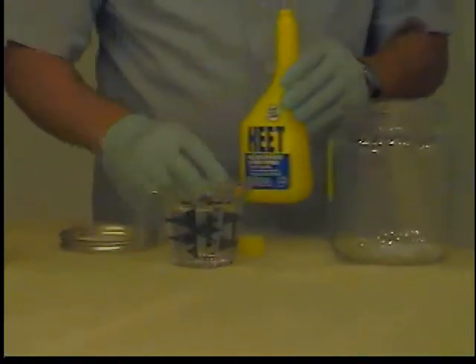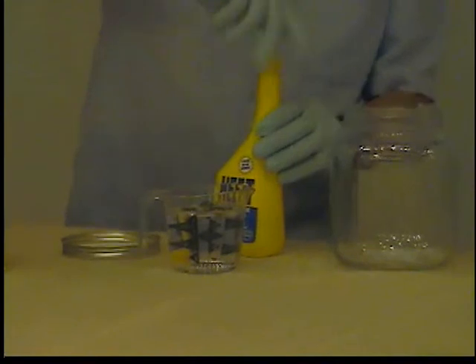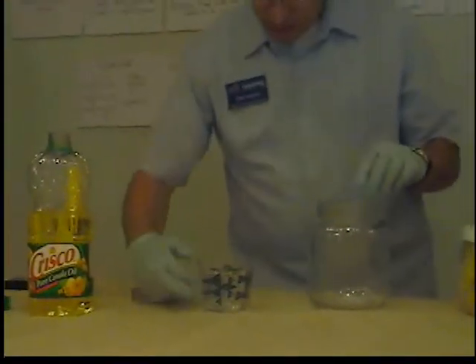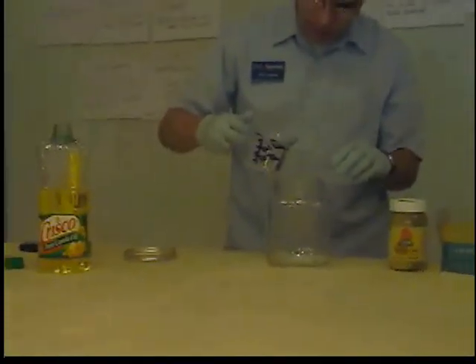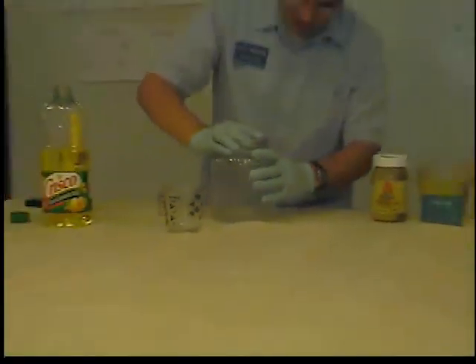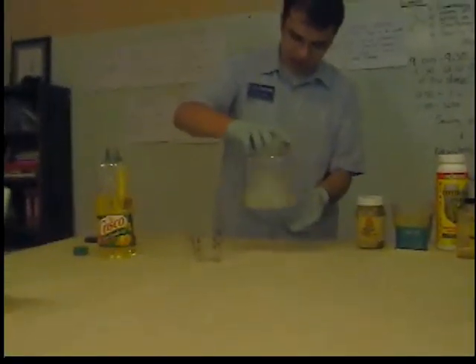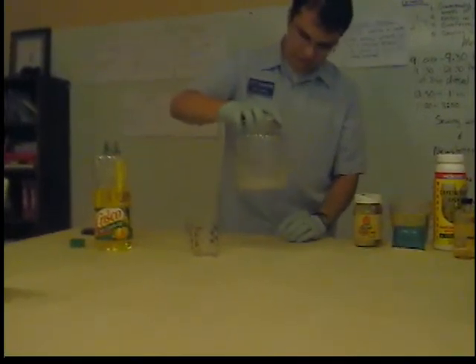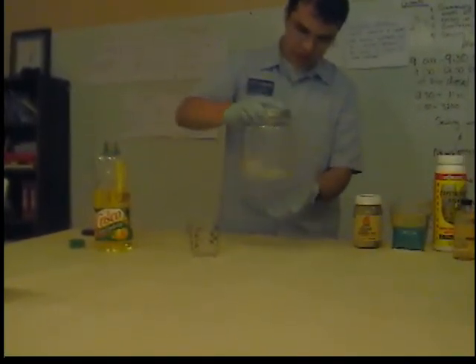That's about 250 milliliters. What we're going to do is go ahead and pour this in here. We're going to cap this and just kind of shake it around like this. We did spill just a little bit — that should be okay.